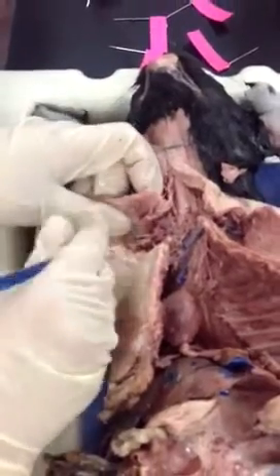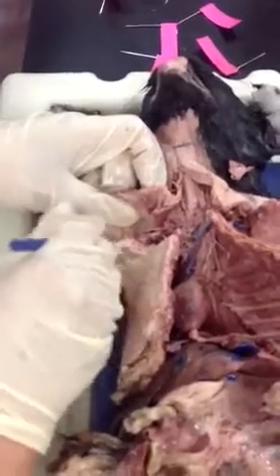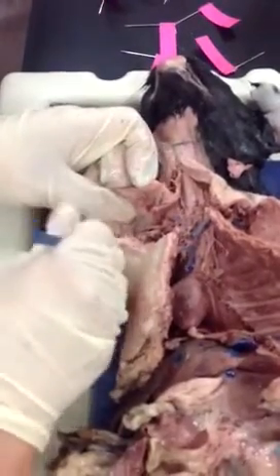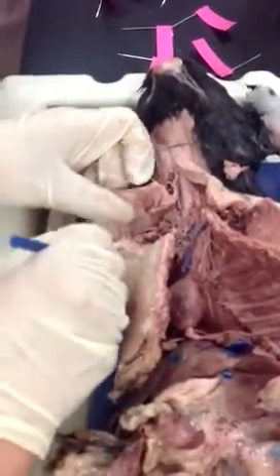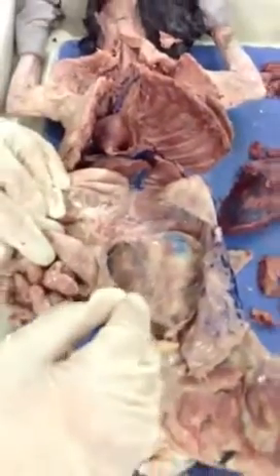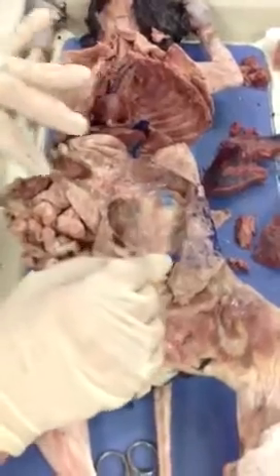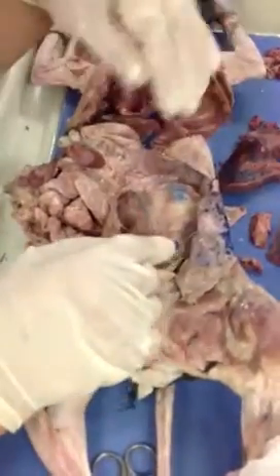So far, so good? Where's the thyrocervical? The thyrocervical usually gets cut off because these are very small caliber blood vessels. Okay. So just continue dissecting, and then also you're going to start dissecting a little bit of the lower arteries. I guess we could start doing it, right? Yeah, let's do that.